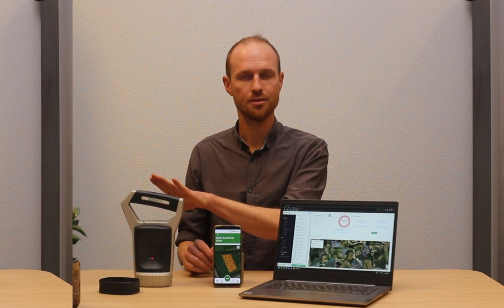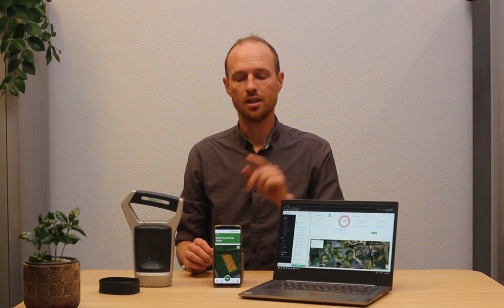I'm business developer for AgroCares, and today I'm going to show you our latest product, the Carbon Monitor solution, which consists of the management portal, the sample taker app, and the AgroCares scanner app. I'm going to show you now how to create a project, synchronize it with your app to get the sampling plan, and then go to the field and take some samples.